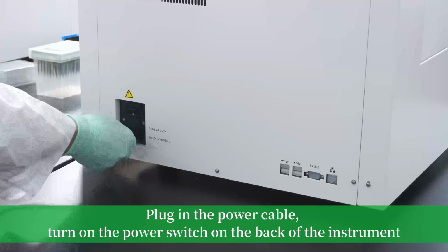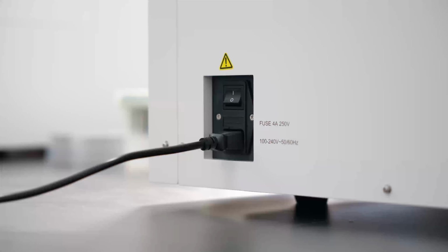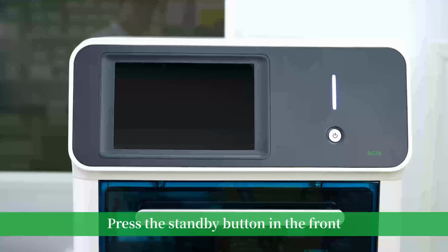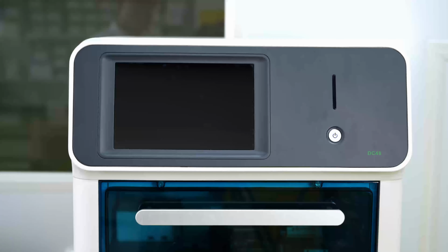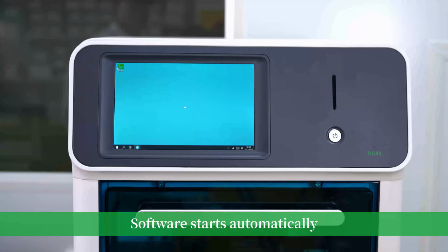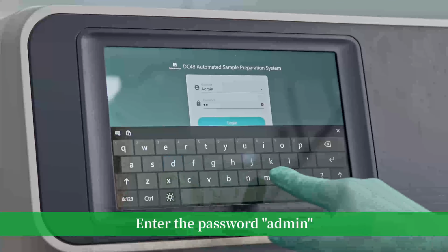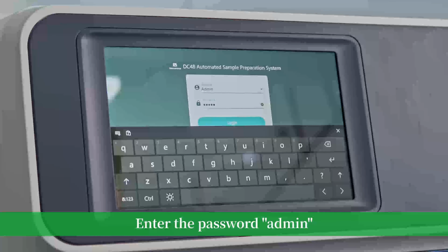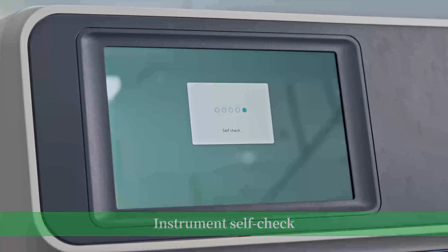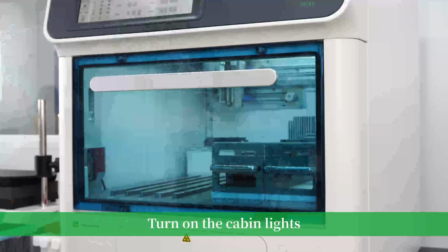Plug in the power cable. Turn on the power switch on the back of the instrument. Press the standby button in the front. Software starts automatically. Enter the password admin. Instrument self-check. At the software interface, turn on the cabin lights.